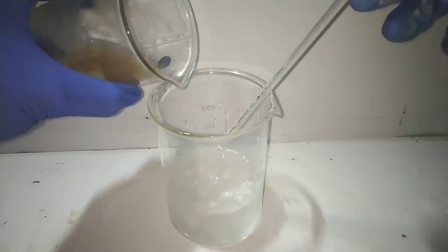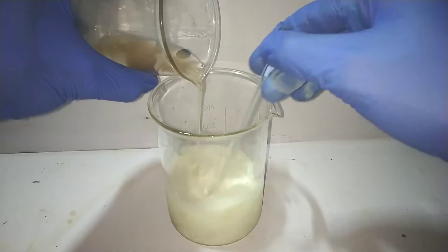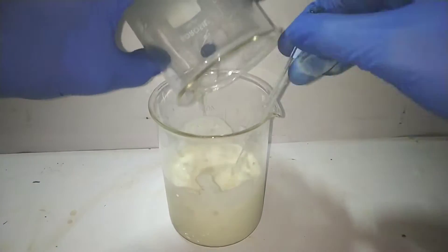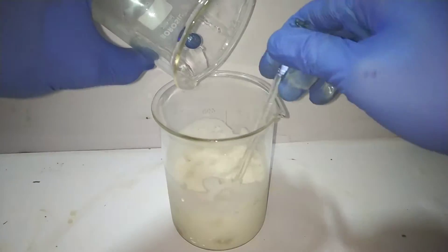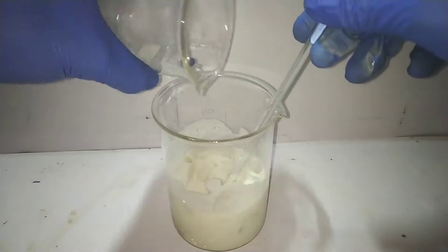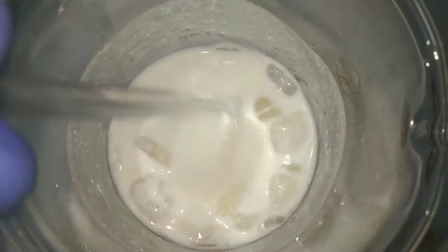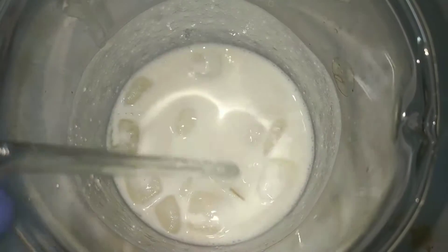Then we pour the reaction mixture onto 125 grams of crushed ice taken in a 500 ml beaker. This will precipitate out the paranitroacetanilide. Use a glass stirring rod to mix everything up. After adding it, we allow it to stand for 15 minutes before filtering the solution, to ensure complete precipitation of paranitroacetanilide.